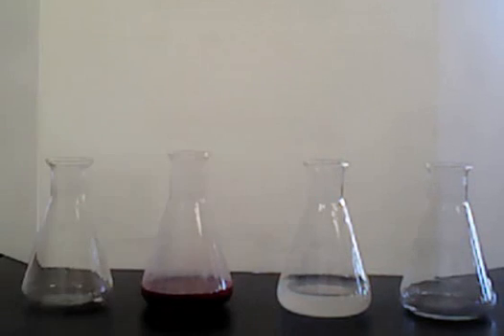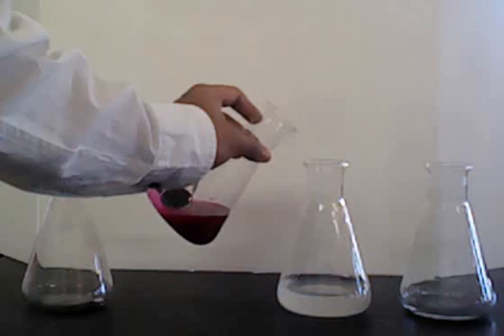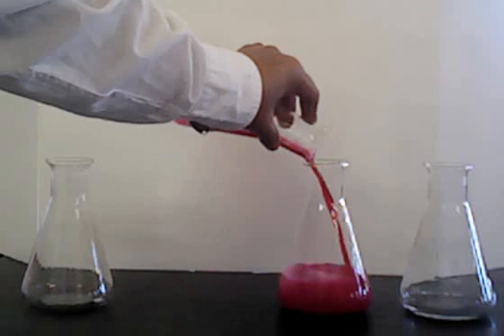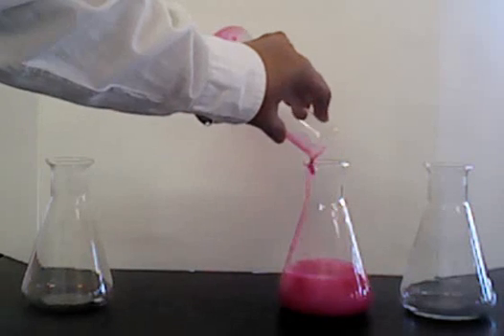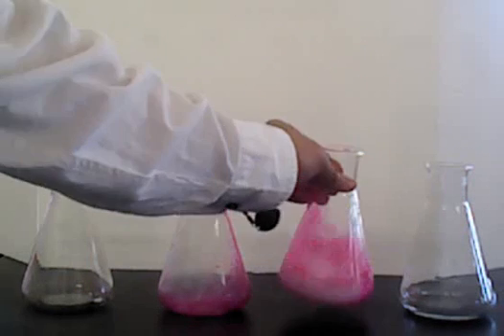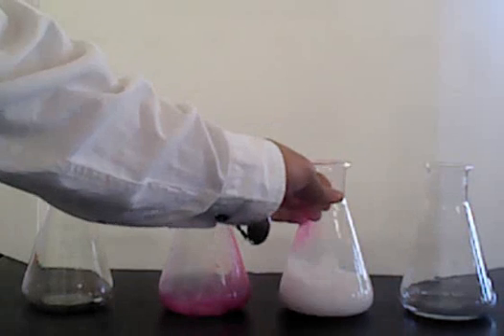And then if I go further and I throw the red liquid into the second Erlenmeyer flask, we see that it turns white.